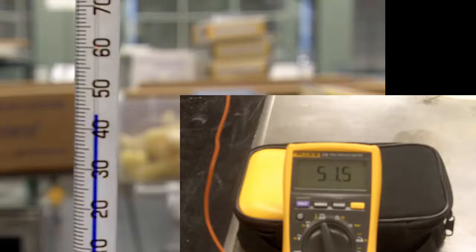The thermocouple is reading 50 degrees and you can see on the thermometer we're actually at about 45 degrees - already five degrees lagging behind in terms of the temperature within the sample chamber. Now the thermometer is reading roughly 60 degrees and the digital is at 72-73 degrees, so now we're over a 10 degree difference as we're going.